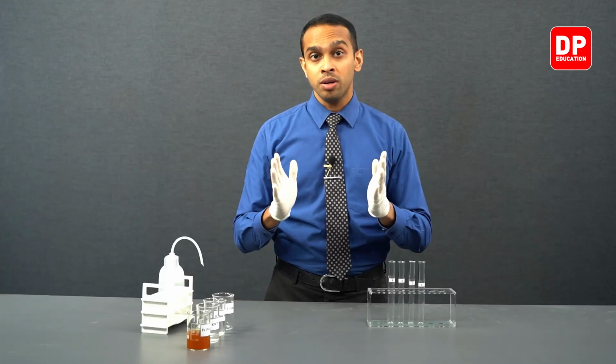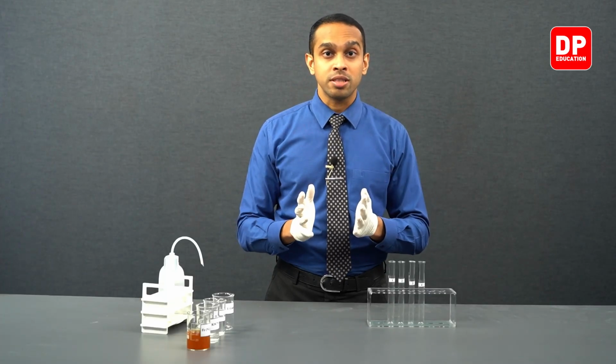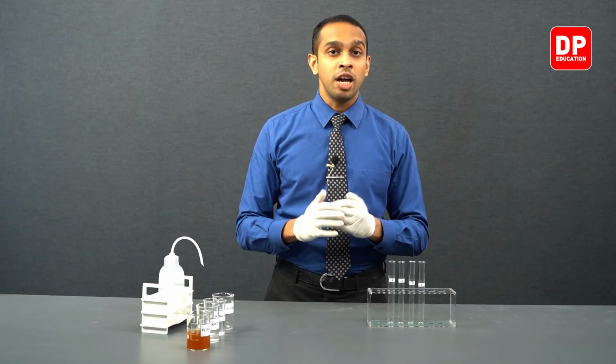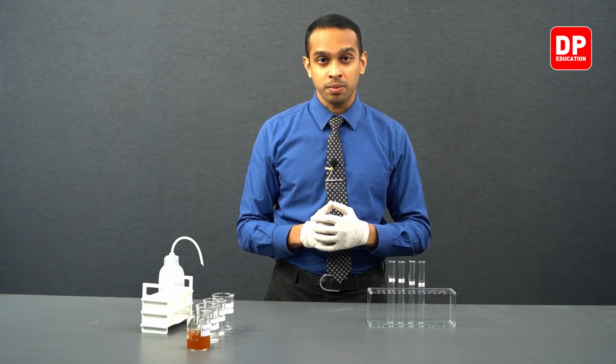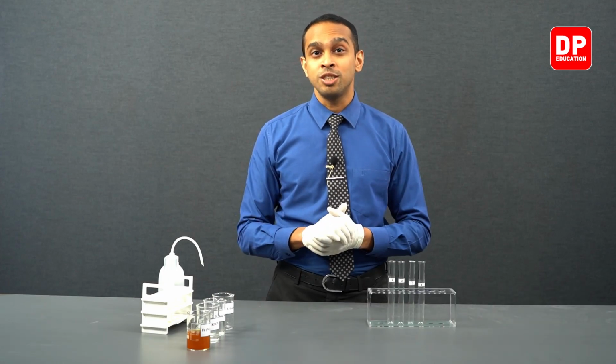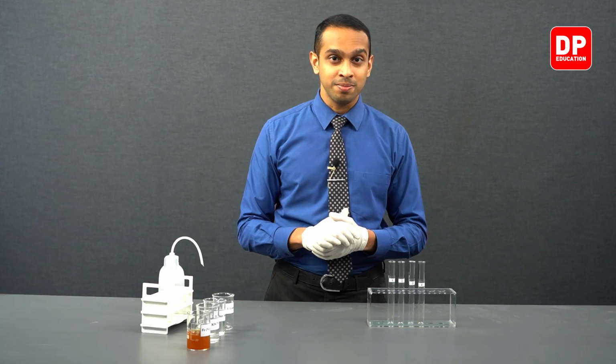When it comes to ferric salts containing Fe3+ ions, when you dissolve them in water, you normally observe a yellow-brown color solution. This is due to Fe3+ ions deprotonating the water ligands that are attracted to it and forming ferric hydroxo complexes. These are usually yellow-brown in color.